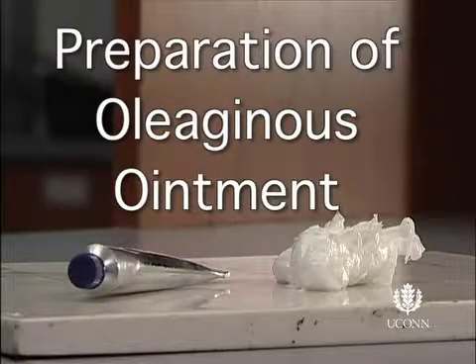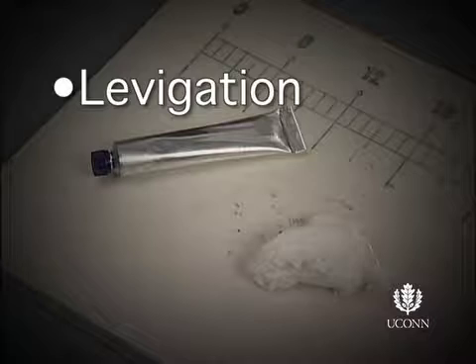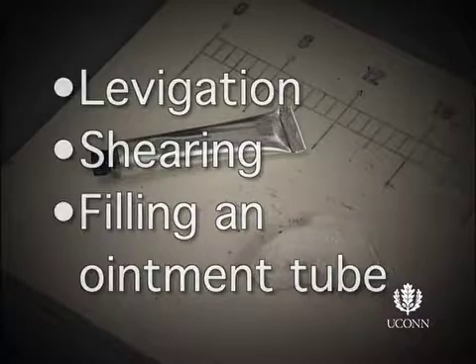In this lab, you will prepare and package an oleaginous ointment. Techniques discussed in this video include levigation to reduce particle size and shearing to homogeneously mix the preparation, as well as how to fill an ointment tube.